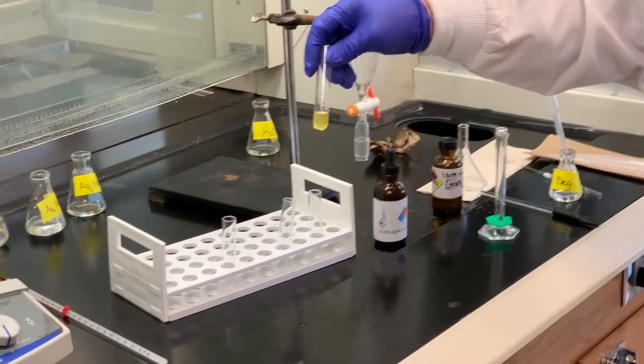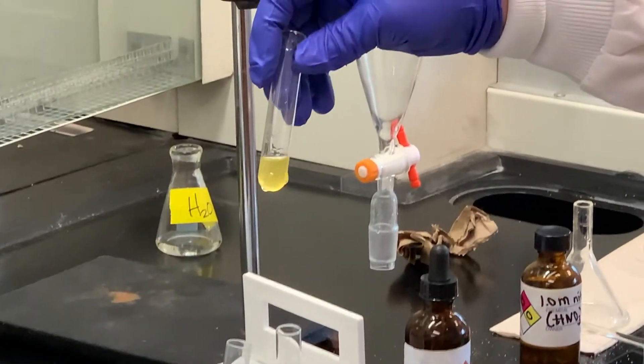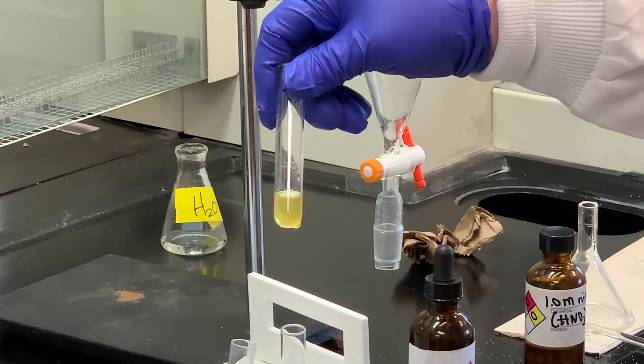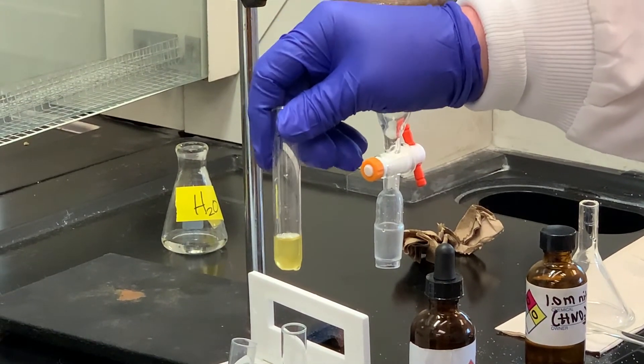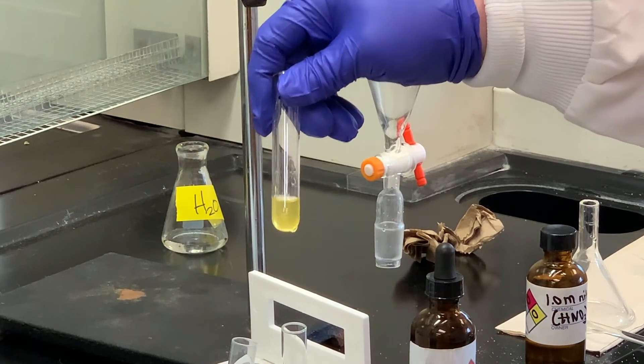As you can see, it's been five minutes heating in the warm water bath at about 50 degrees. There is no change in the test tube — no precipitate formed, which is exactly what we wanted to see, because what that tells us is that our substrate was tertiary.